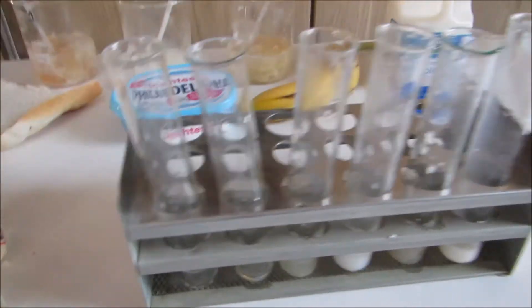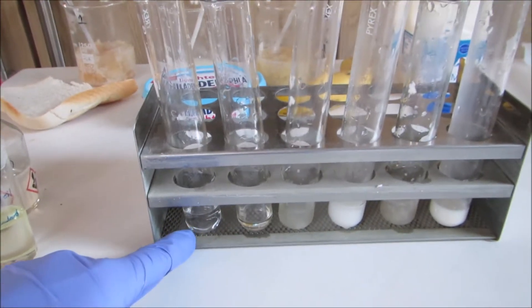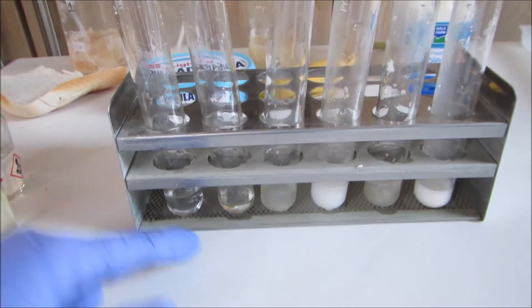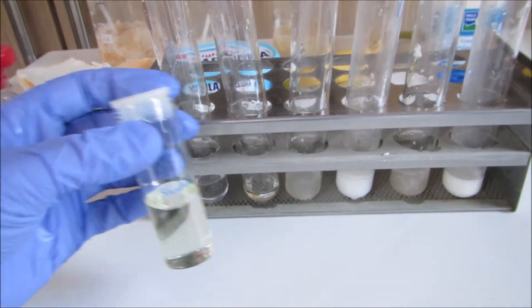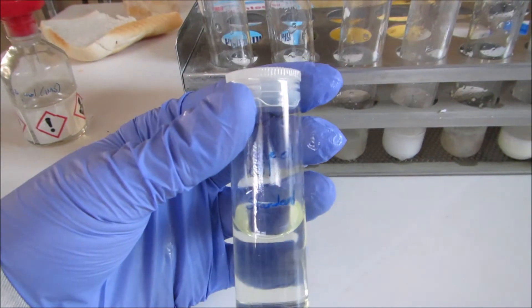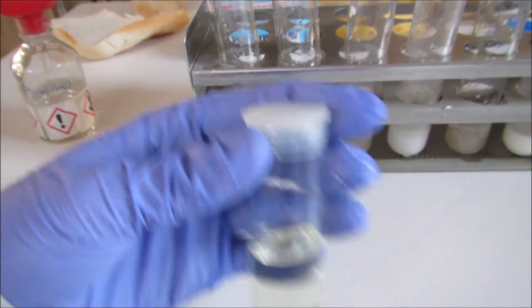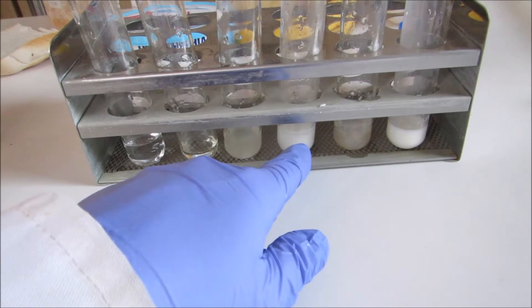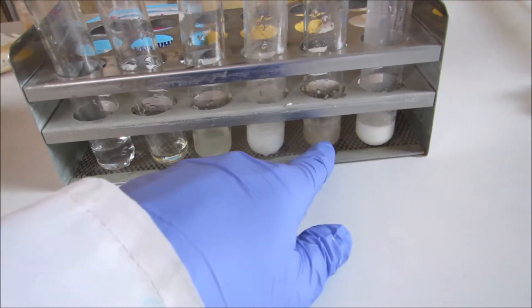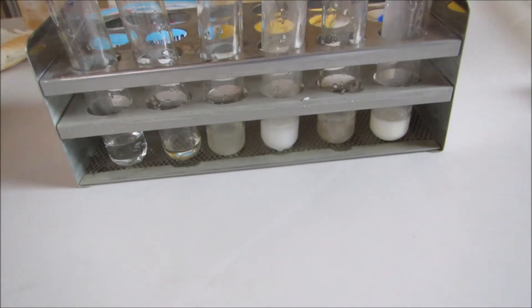I've set up the test tubes. The first is the deionized water for the negative control, and the second is for the positive control — for fats I've just used olive oil. Then we have our bread, our cheese spread, our banana, and our milk.